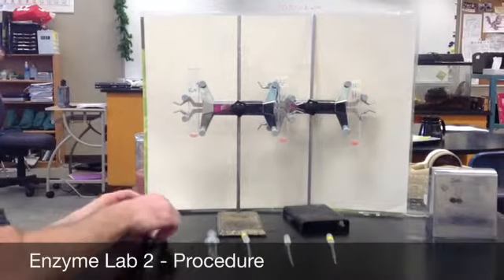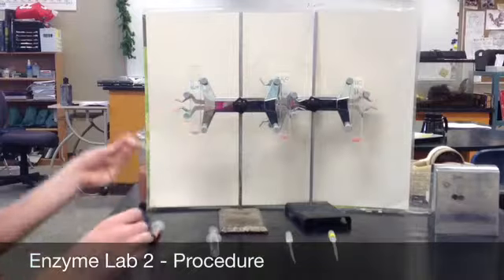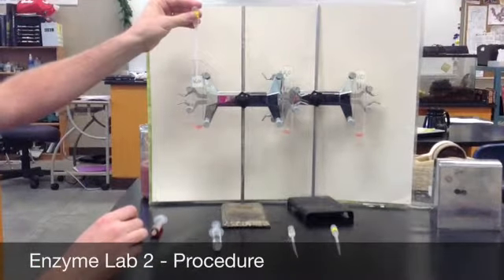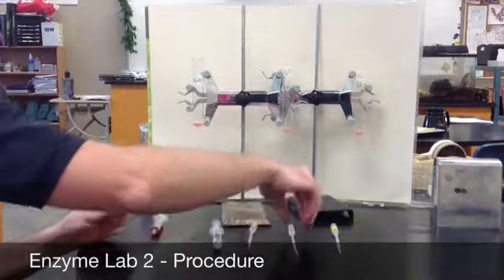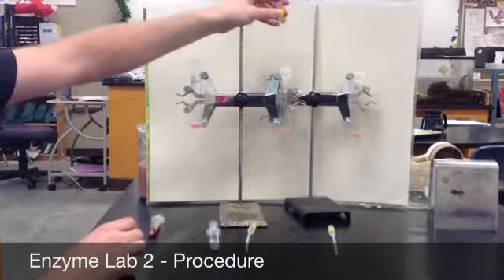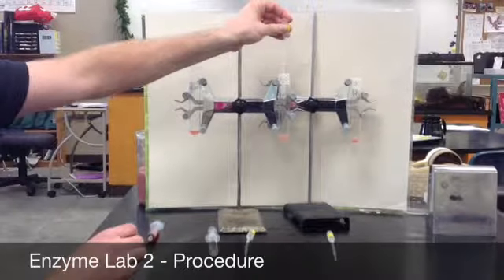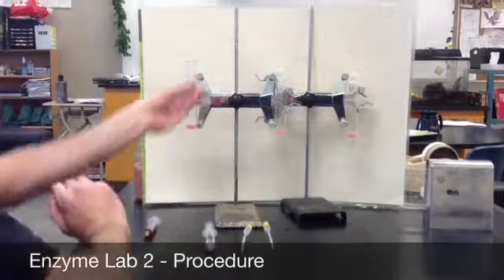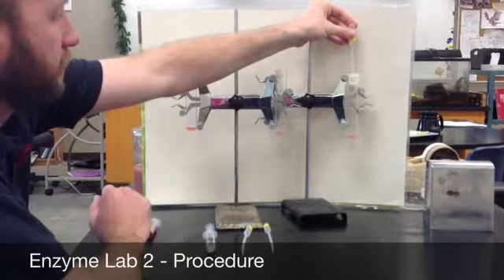Next, we are going to add our solutions, which are going to change the pH. First, we'll add 1 milliliter of sodium hydroxide to this first test tube, which will give us a basic solution. We are going to add just plain distilled water to this middle test tube to give us a neutral solution. And we are going to add a milliliter of HCl to this last test tube to give us an acidic solution.